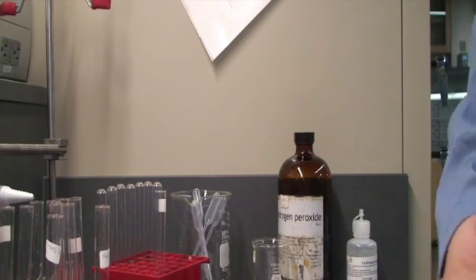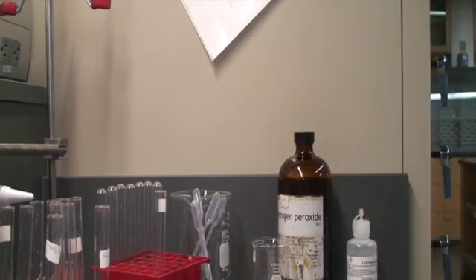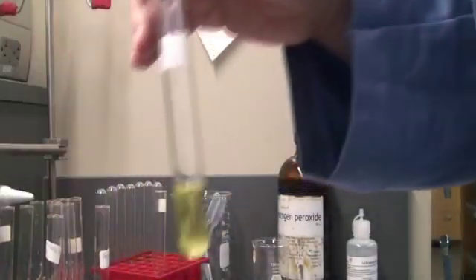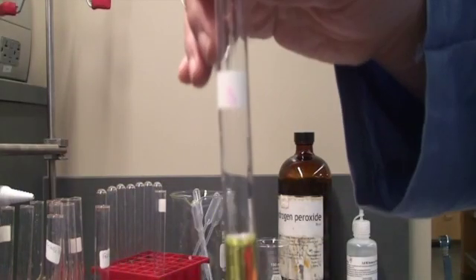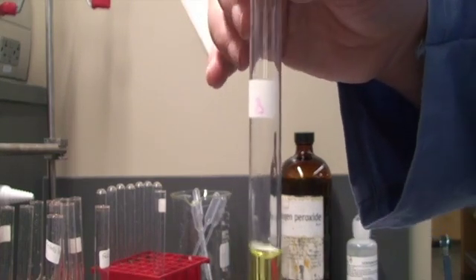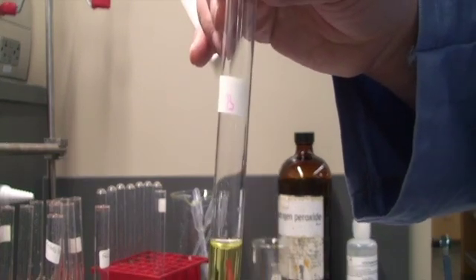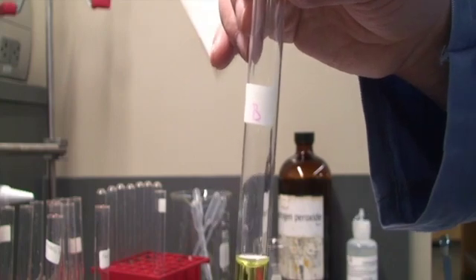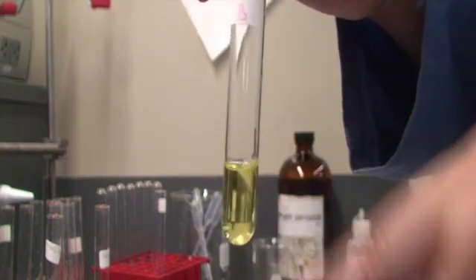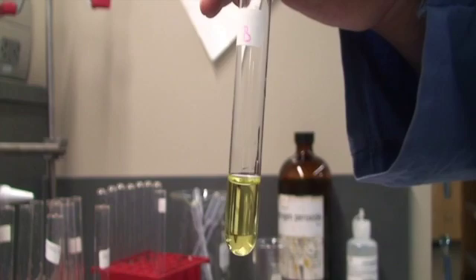In part 2 we're going to take a look at how pH conditions affect redox reactions. We're going to start with a solution of iron(III) chloride, which is an acidic solution. This has a very light yellow color.